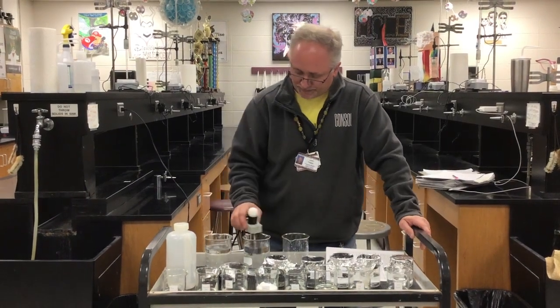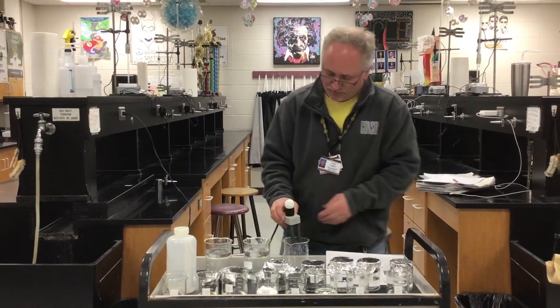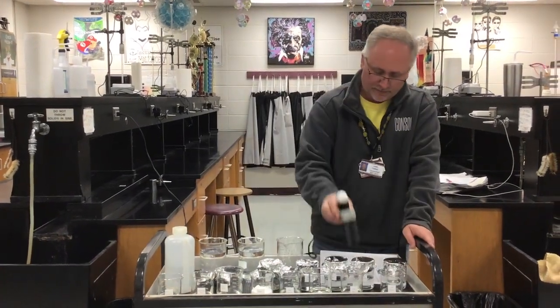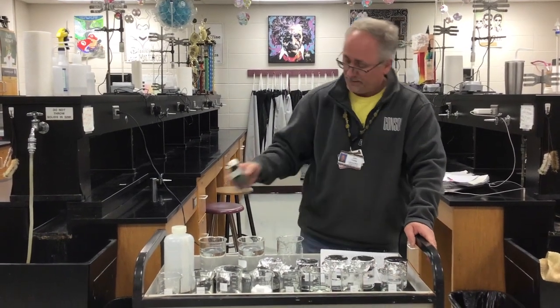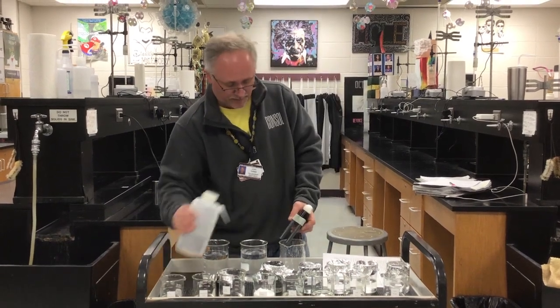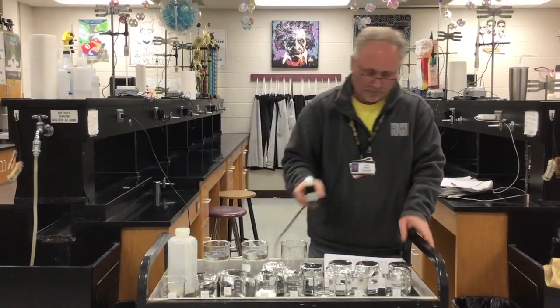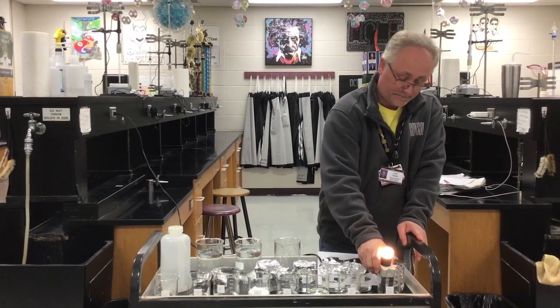The next one is 1 molar hydrochloric acid. Hydrochloric acid is HCl. It is a strong acid. You guys will see if this actually conducts electricity or not. It does. If I take it out of the hydrochloric acid and do a little cleaning, the next one is 1 molar sodium hydroxide, which is a strong base. Put it in the 1 molar sodium hydroxide. There you go.